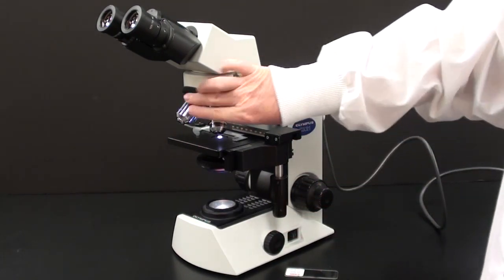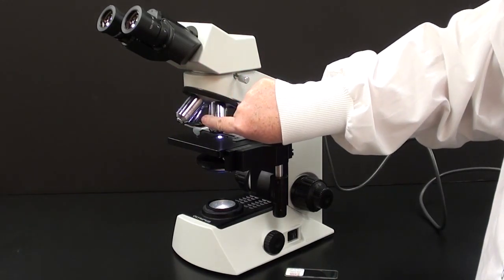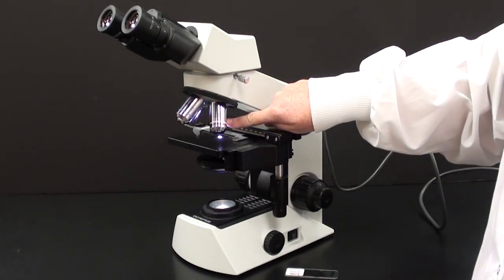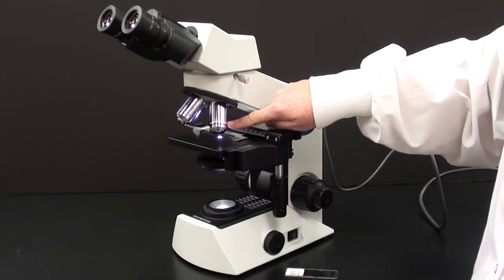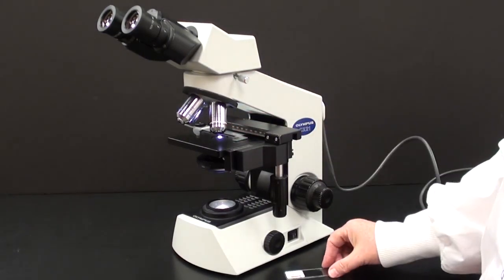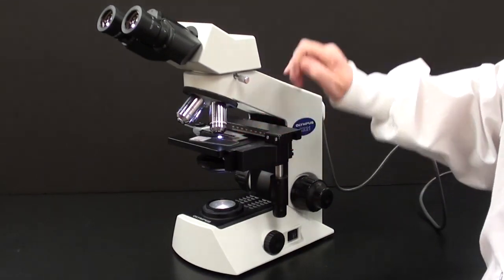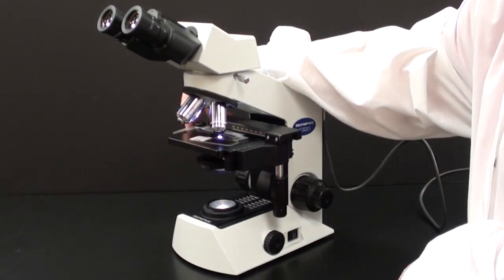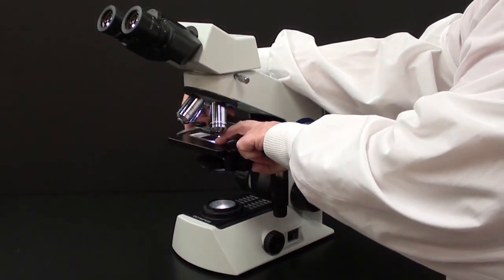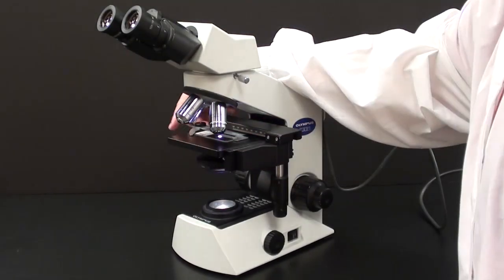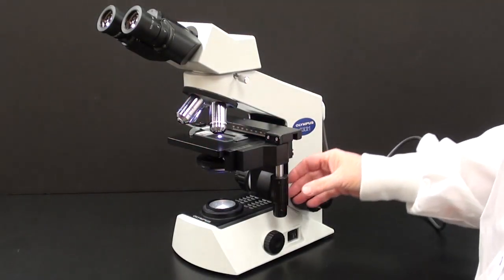You should have already turned the objective lenses so that the smallest lens, the scanning lens, is facing down. Take your slide and place it on the stage. Use the slide clip to hold the slide securely in place.